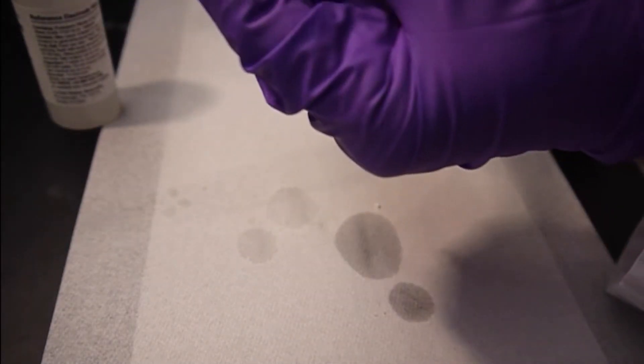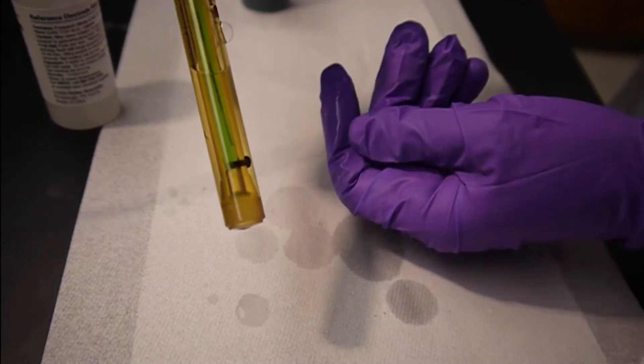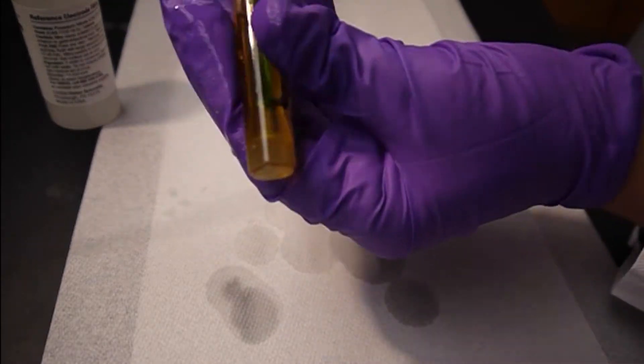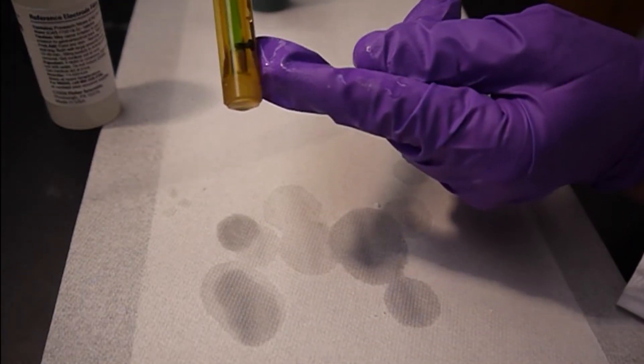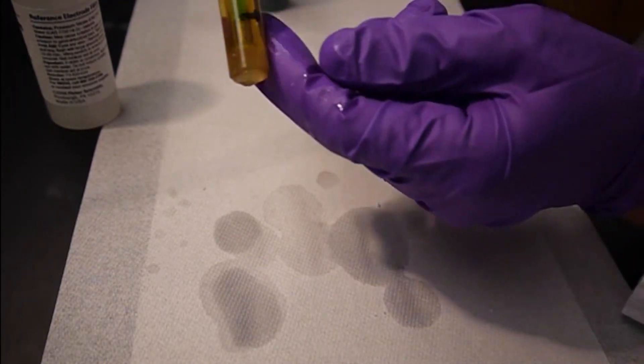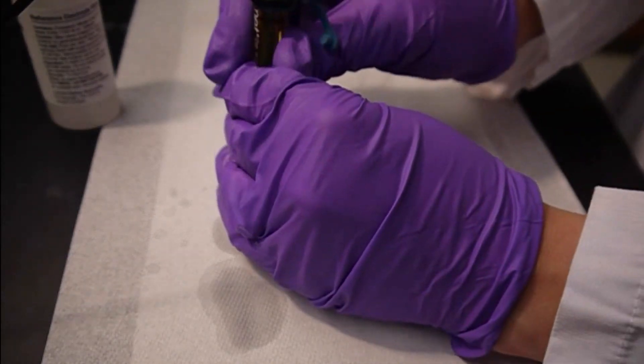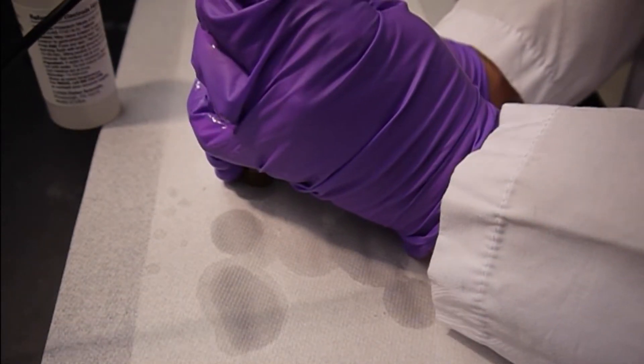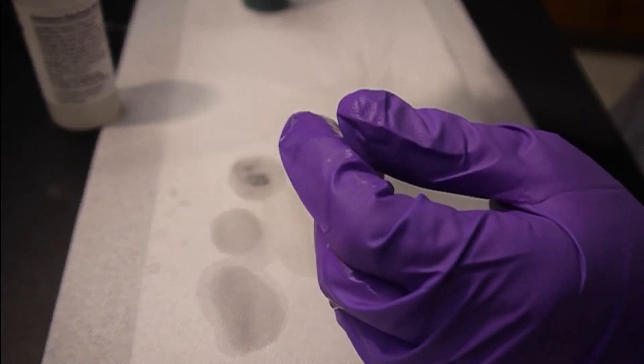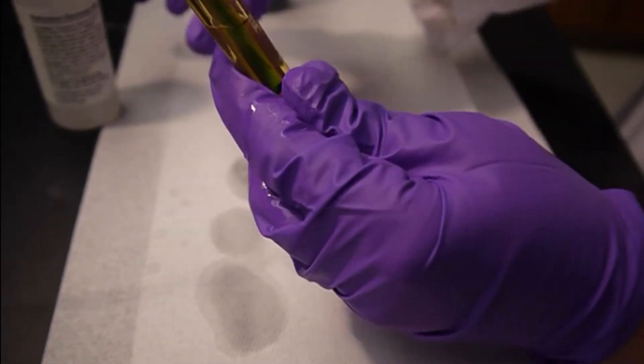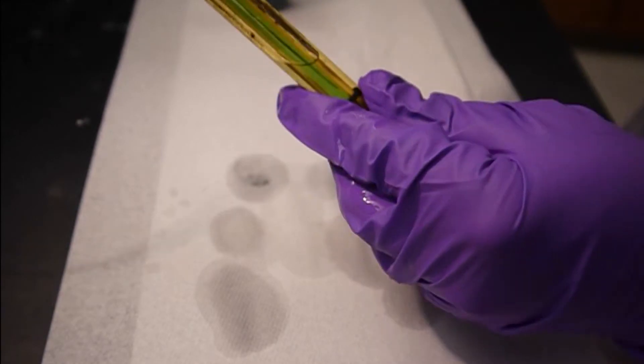And it's dripping out the bottom here, which actually is good, because we want to make sure that the gap between the inner electrode and the outer electrode is wet with the solution. So now I'm going to tighten that up a little bit and continue filling.